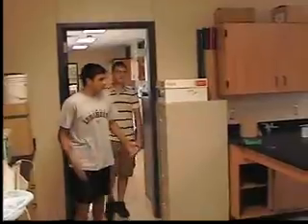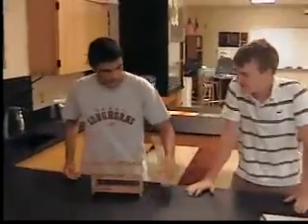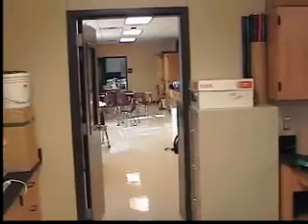Dude, let me show you how we do stuff around here. Alright. I'm just gonna do a simple experiment. Hey, shouldn't you be wearing goggles for this? It's sulfuric acid. Nah, it's okay. Ah! You okay, man? You okay? Dude, what the freak?